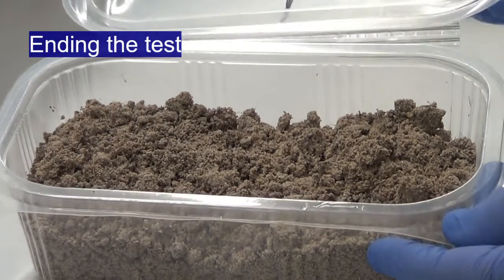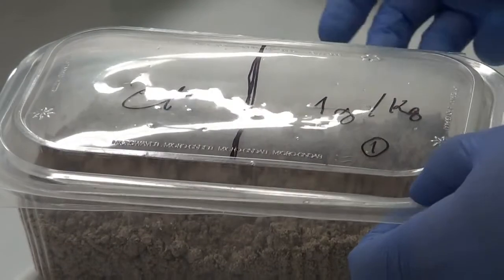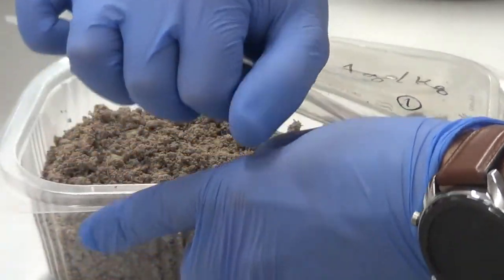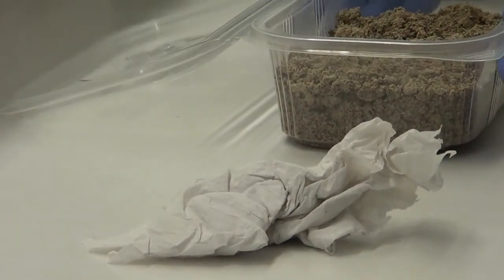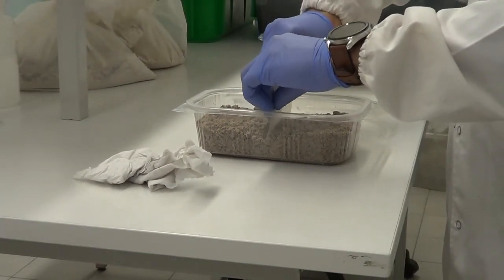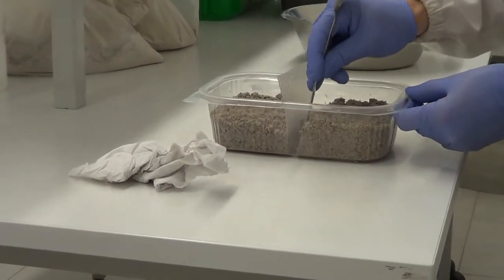Okay, as you can see, the earthworms are completely buried. This is the end of the test, 48 hours after starting. So we open the replicate and let's finish the test. Usually what we do is reinsert the divider. We try to separate both sections of the soil.